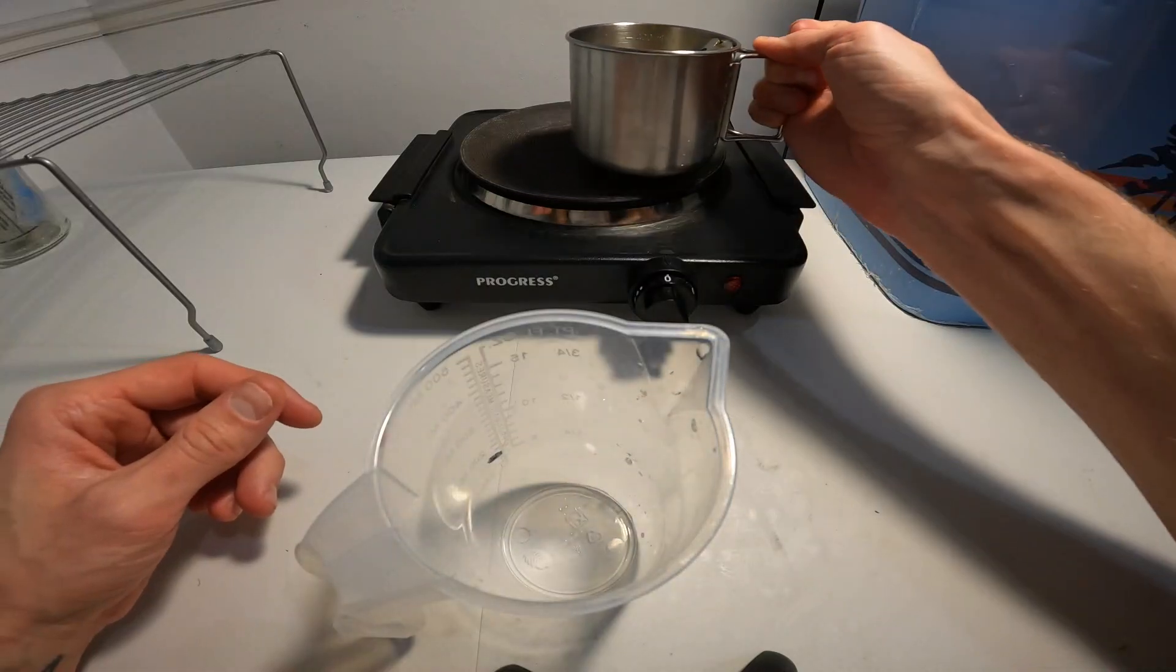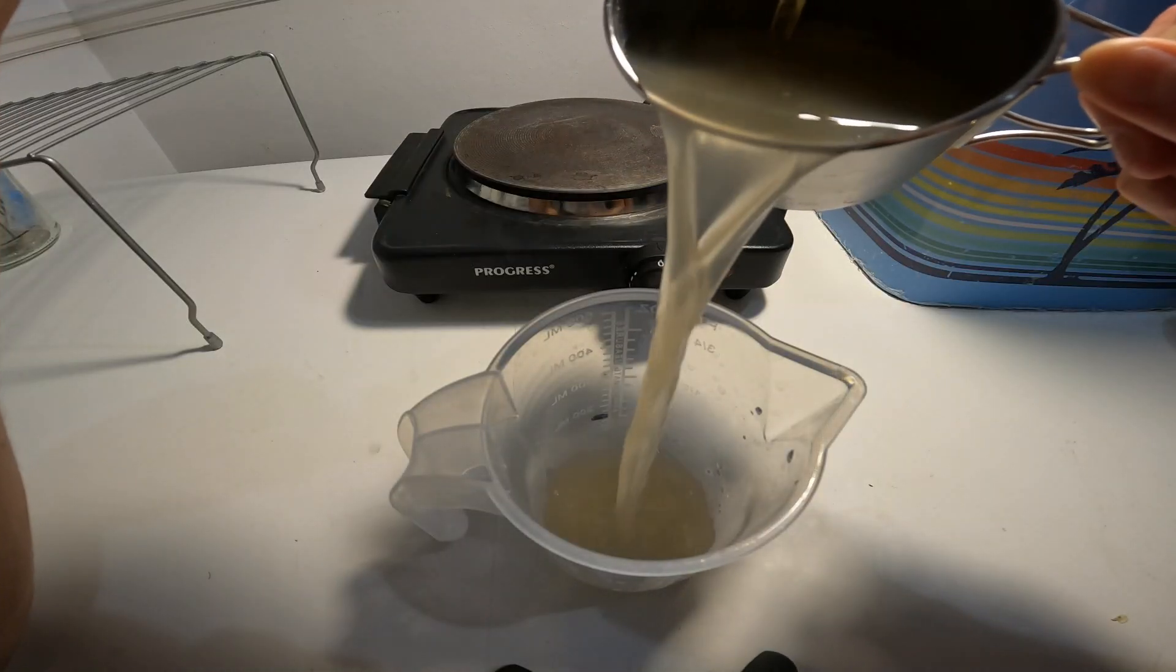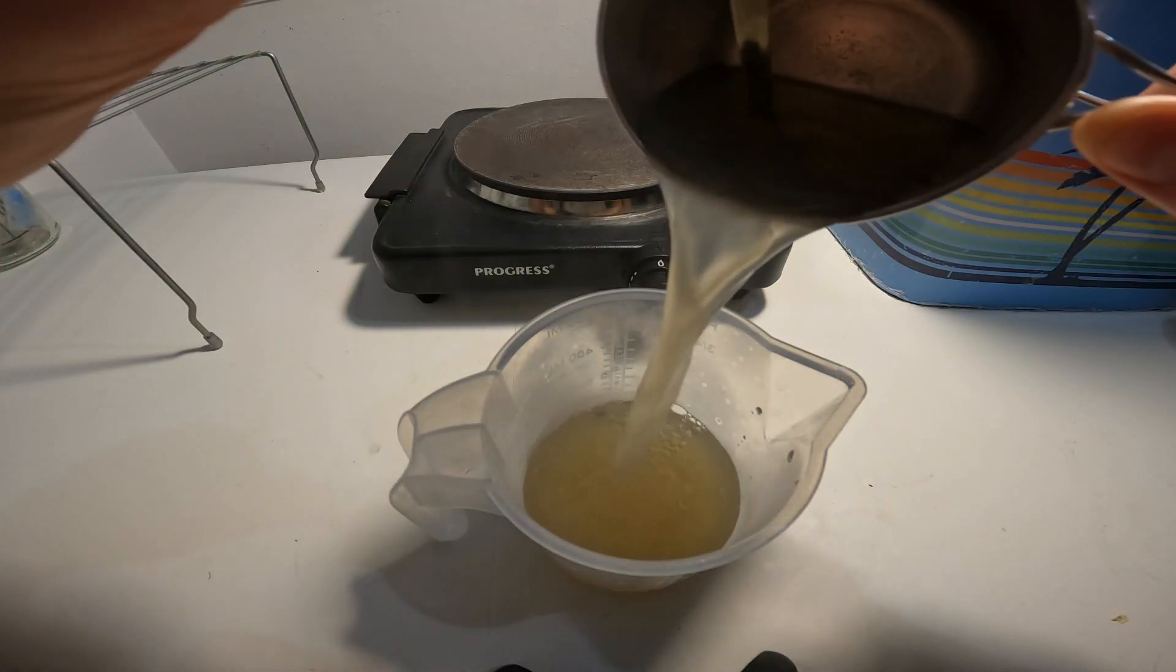After burning my hand, I put the liquid back into the measuring jug so it was ready to pour into the pots.